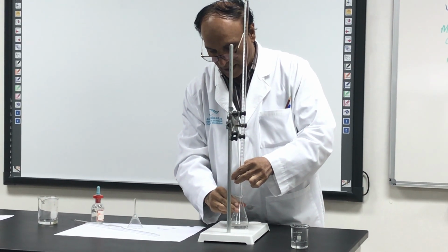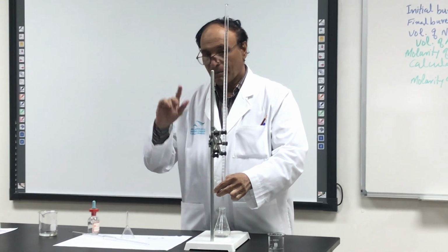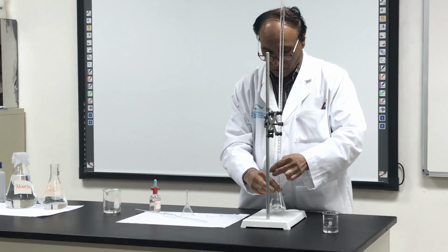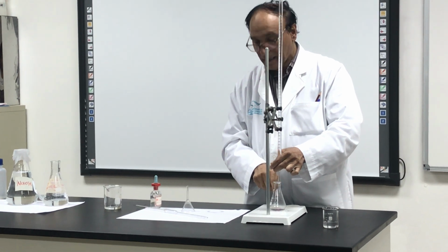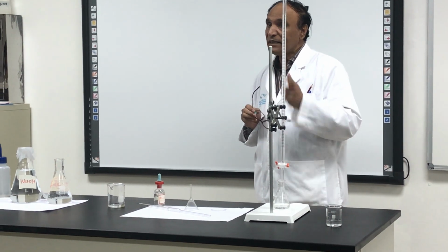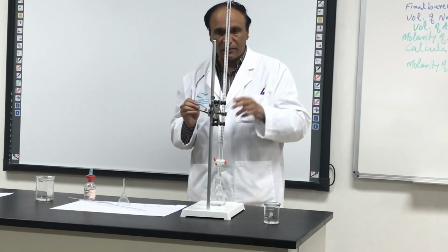Even you can add a drop at a time. Look at that. Is the drop there? Yes. A drop at a time. But in the beginning, when you add it, you can add even a little more. No need to put the drop. Can you see the pink color there? Yes. The pink color comes and the pink color disappears. We want to do the experiment until the pink color comes with one drop and does not disappear. Okay? We want to do that one.